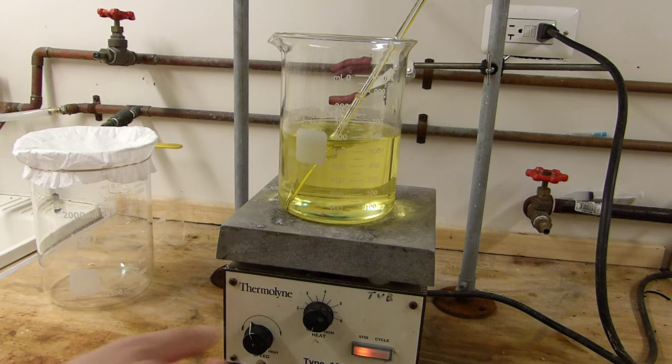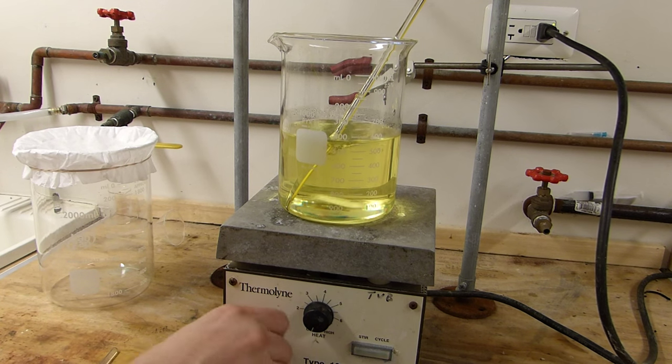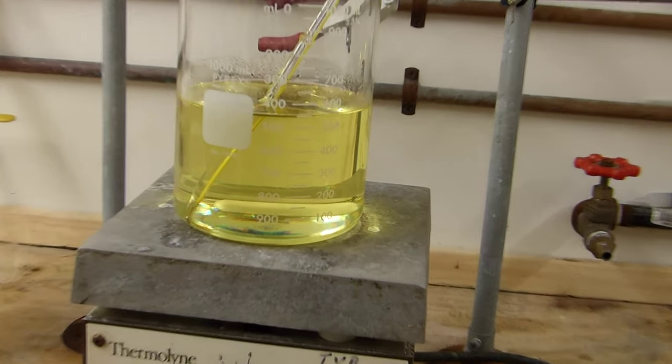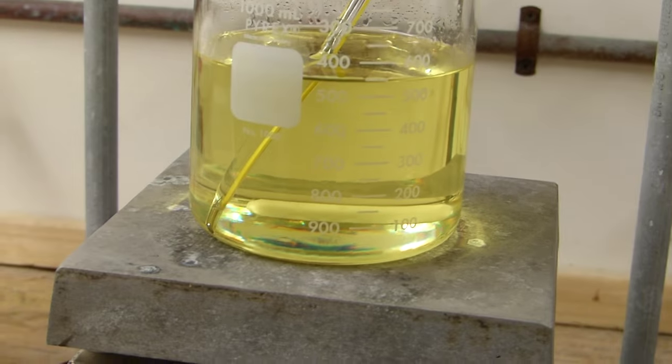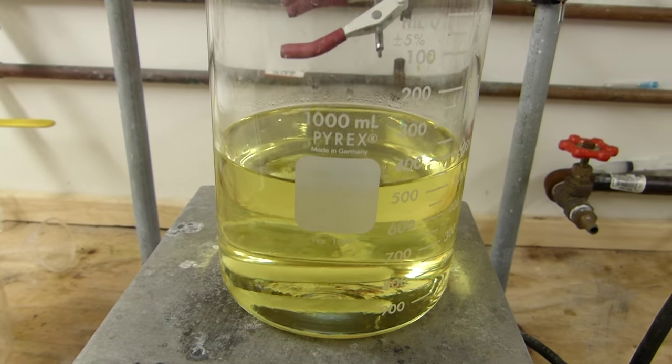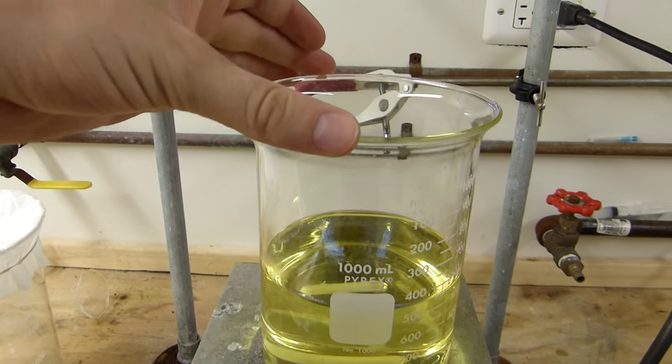I'm actually not going to filter this because this looks very clear, actually. That's really quite nice. All that's left to do now is to allow this to cool and the sulfur should precipitate out and then we can go ahead and recover that.